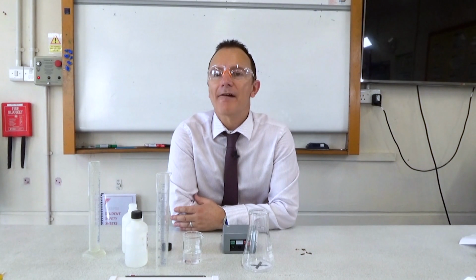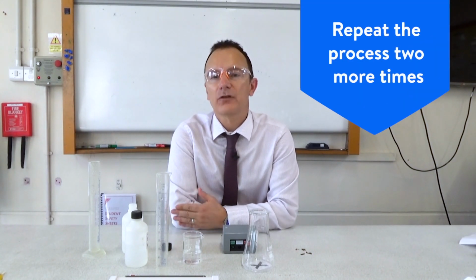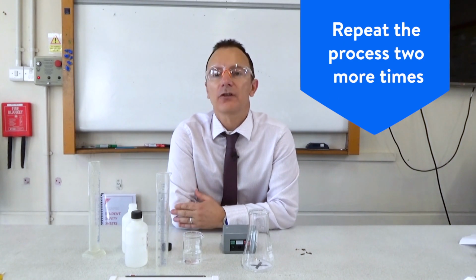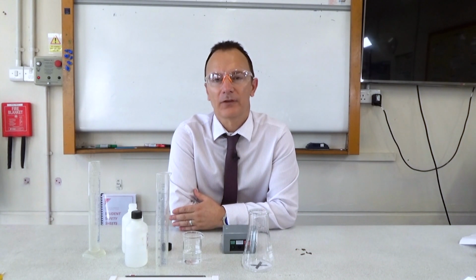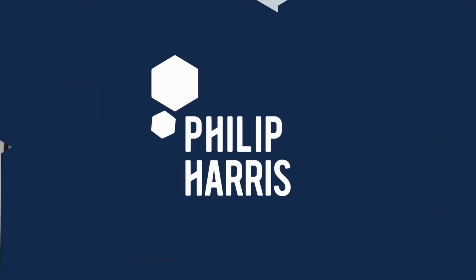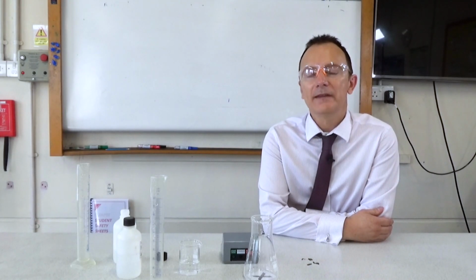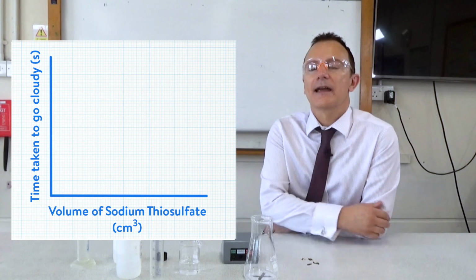When the students have carried out all 5 results, they then repeat the whole process 2 more times so that for each concentration of sodium thiosulfate, they've got a set of 3 results, and they can use those 3 results to calculate a mean. Once they've worked out those means, they would then plot the results on the graph, and the graph would look something like this.